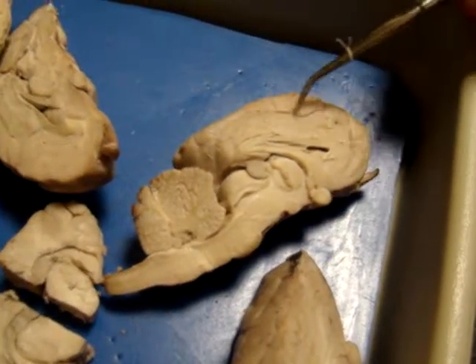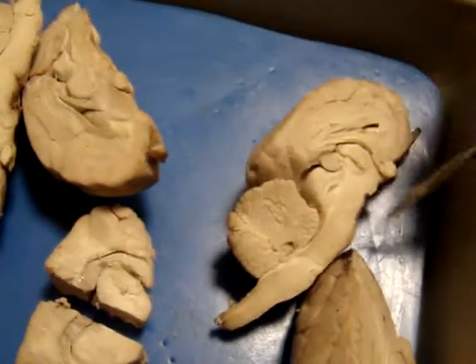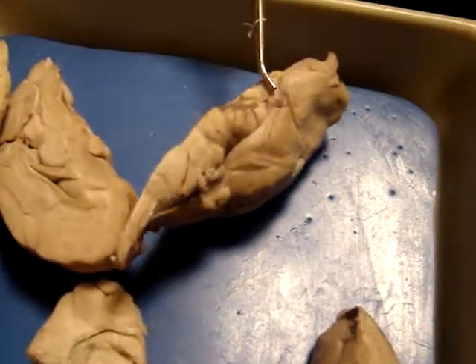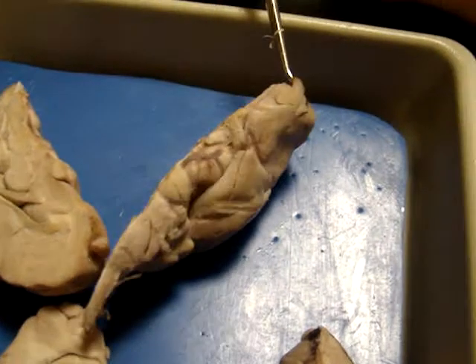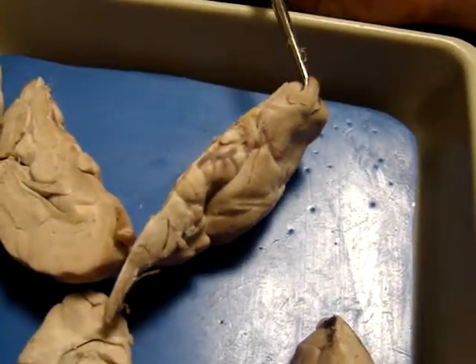Helen just went over one of them on the ventral surface, and she was asking you what they were. If you flip it over and look at the ventral surface. The olfactory bulbs. If you look at the human, they're tiny, teeny, minuscule, and on the sheep they're huge. The olfactory bulbs and olfactory tracts.